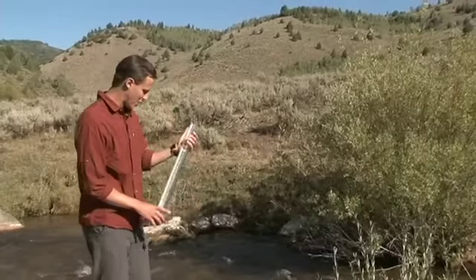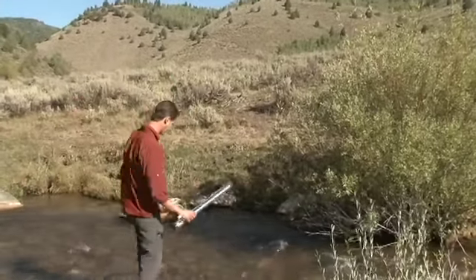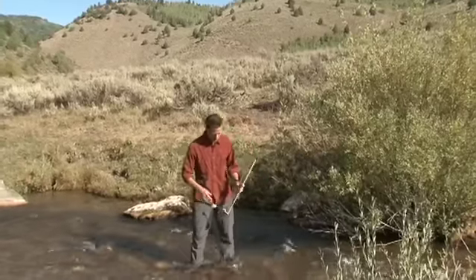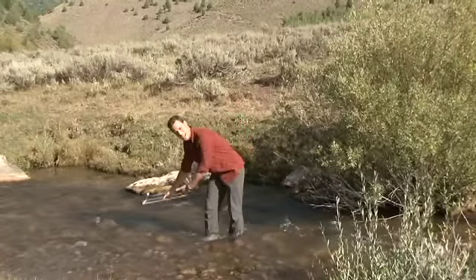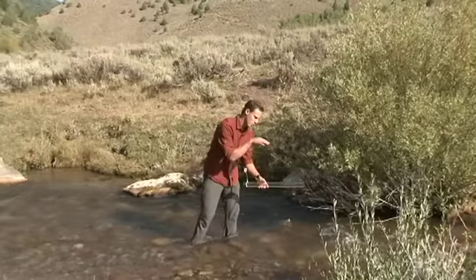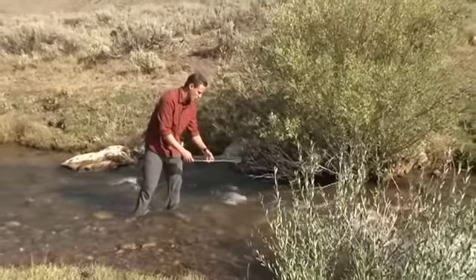The first step is to go into the stream and fill it up. Go to your monitoring location. When you're at your monitoring location, you want to sample the water that's coming from upstream. You don't want to sample the water downstream after you've stirred up the sediment. Take your turbidity tube. You don't want to sample right at the surface — just a little bit below the surface. Stick it down underneath, then put the whole thing up and let it start to fill all the way to the top.